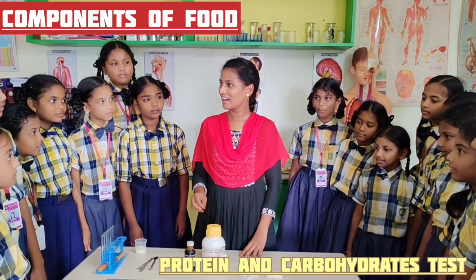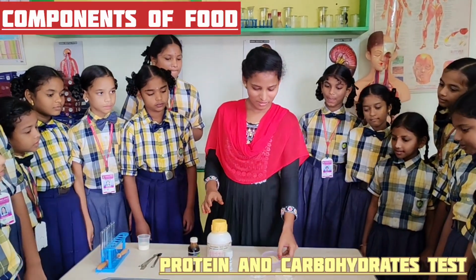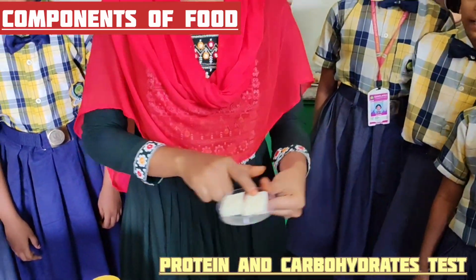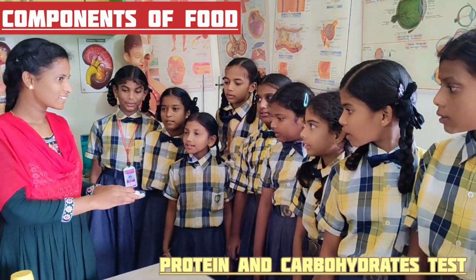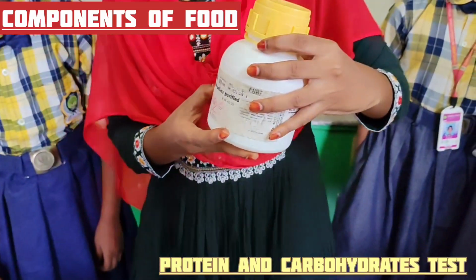Yesterday we discussed how we conduct tests for different food materials. Once you observe this one, what is it? Potato pieces. This one? Bread. Okay. And this one? Rice. Is it raw rice or cooked rice? Cooked rice. Cooked rice.